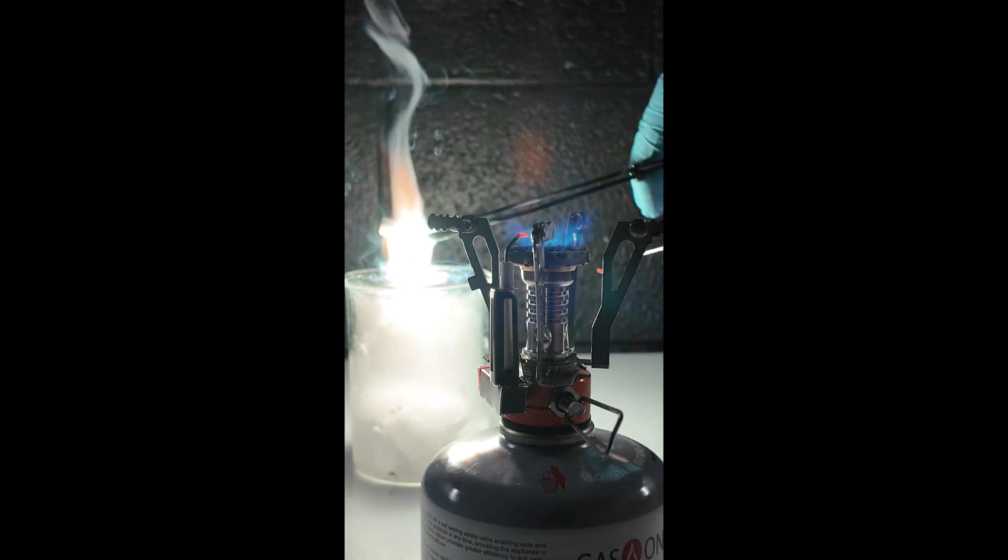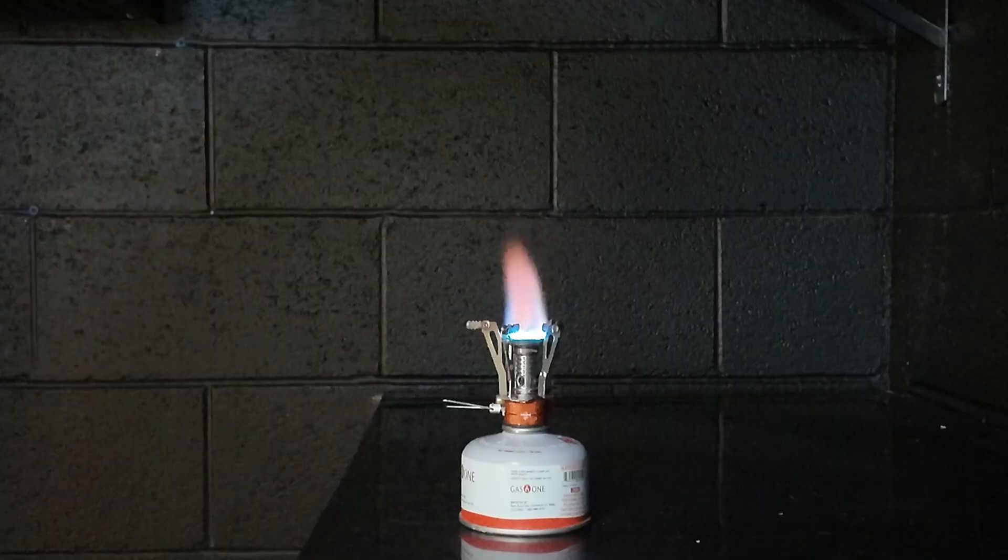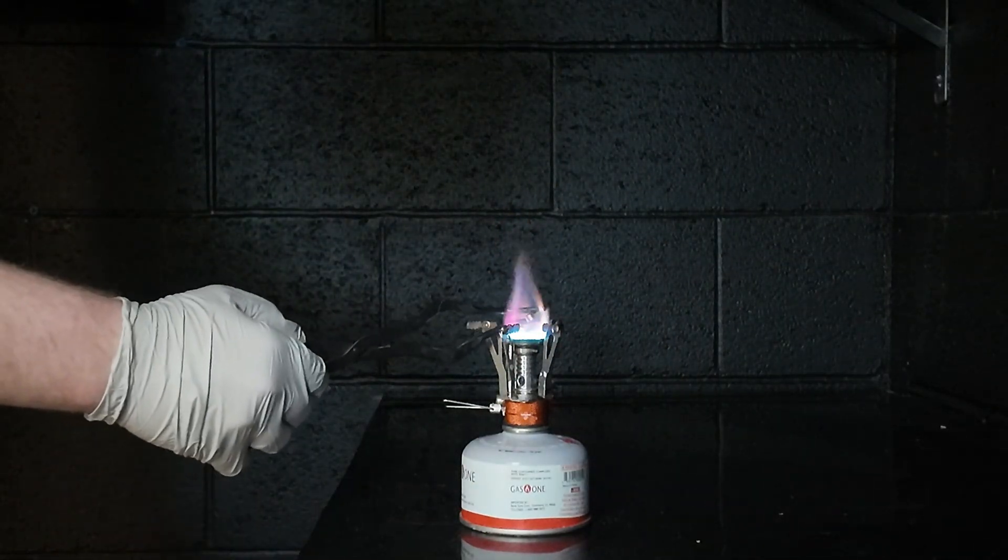As you can see, when the magnesium is burned, it produces this really blinding white light. I still have the little residue in my eye from the light.